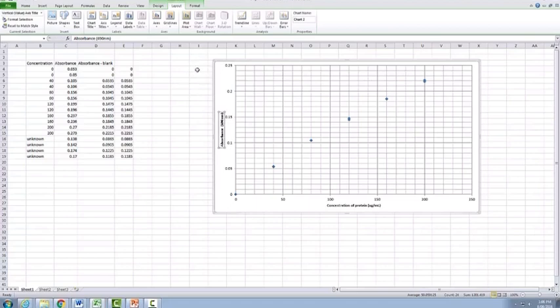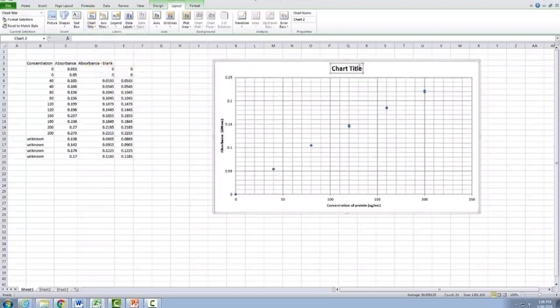Last part of labeling that we need to add is our chart title. Now, as I've mentioned a few times, Excel always puts the title at the top of the graph here. So we can still add in all of our information and then we can move it once we're actually finished labeling it. So in this case here, we have figure 1, standard curve for Lowry assay using BSA as a standard.